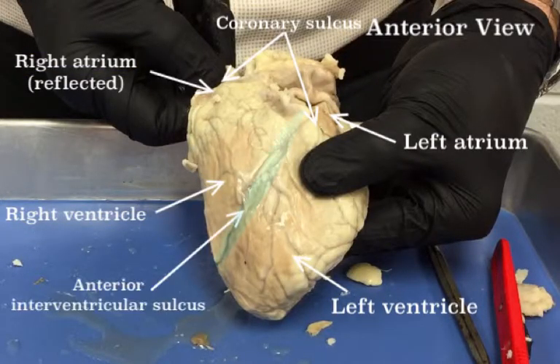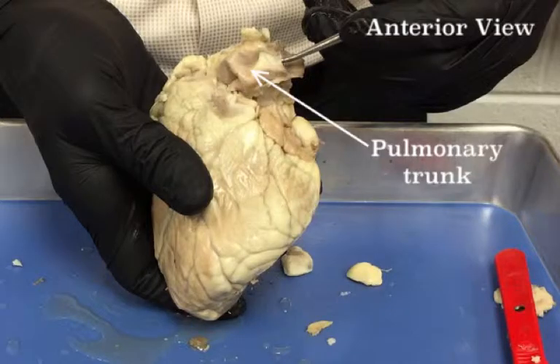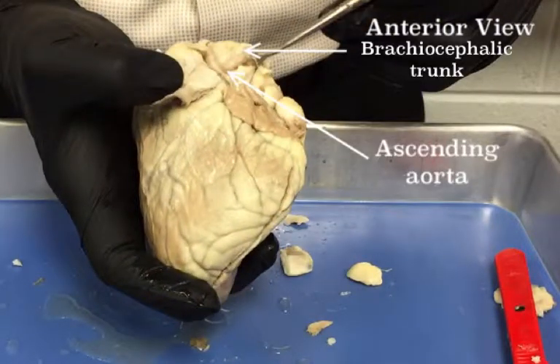You can also see the anterior interventricular sulcus, which is filled with fat. If you remove the fat in there, you can see the vessels that run through it. You can also see the pulmonary trunk coming from the right ventricle and the ascending aorta and the brachiocephalic trunk coming from the left ventricle.